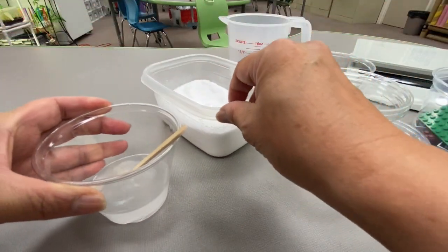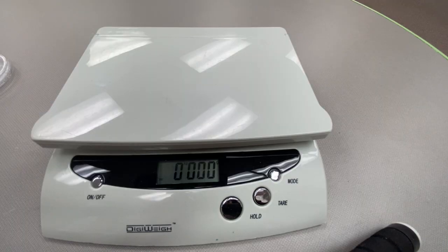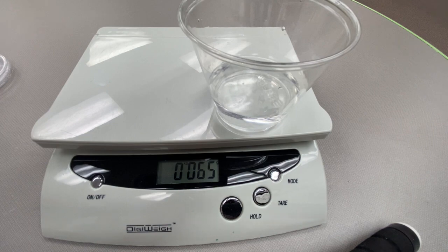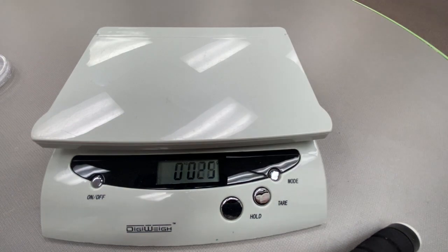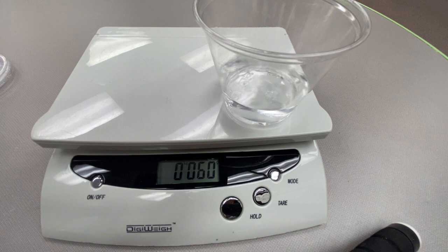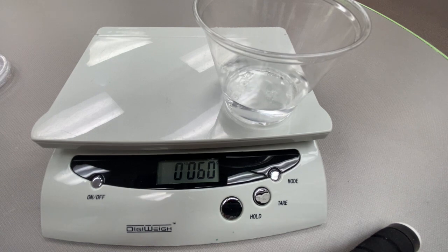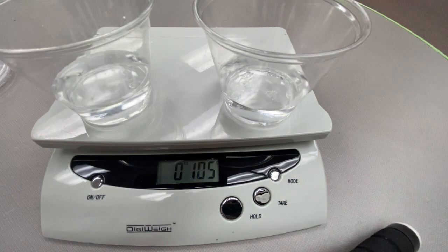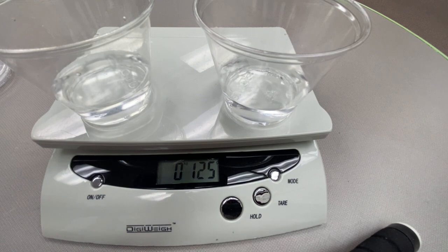One way we can find out what happened to the salt is by weighing the solution. Here is our scale, and here is our salt solution. Our salt solution weighs 65 grams. Now here is our cup of water — 50 ml of water with no salt — and that weighs 60 grams. So even though these two cups look identical, we know which one has the salt in it because it weighs 5 grams more.